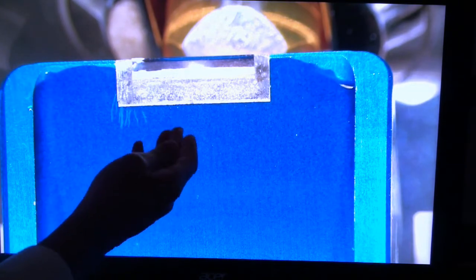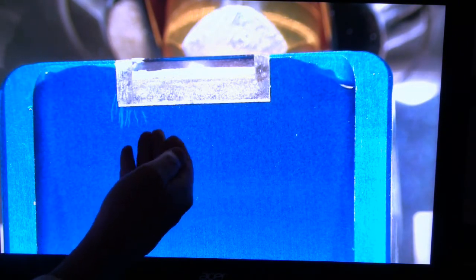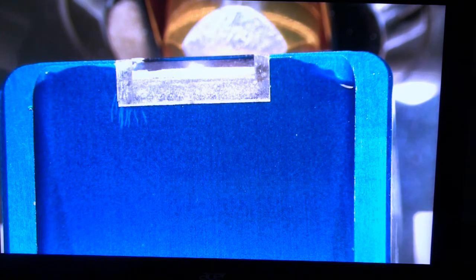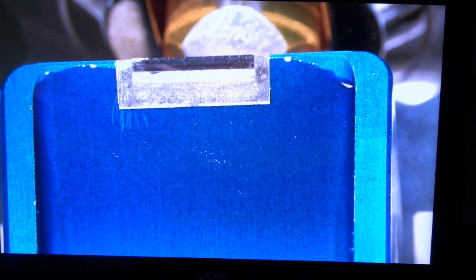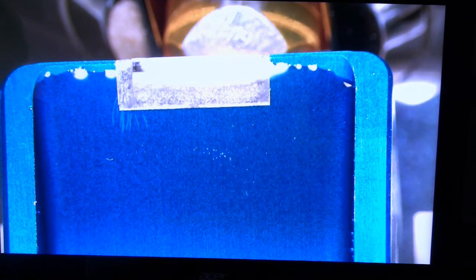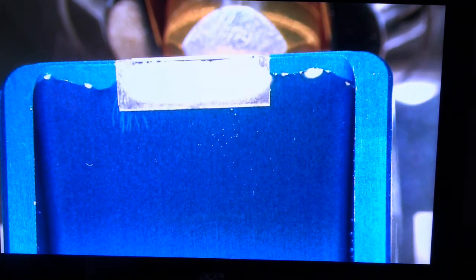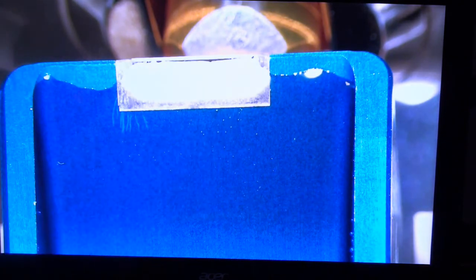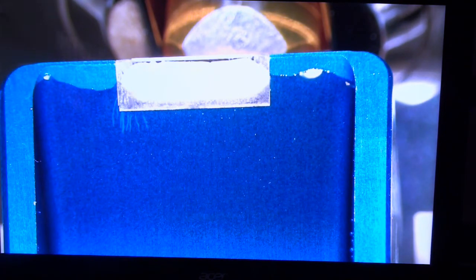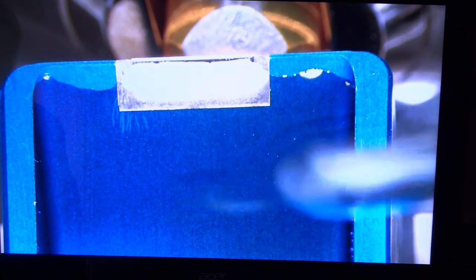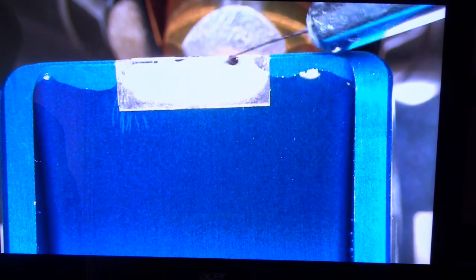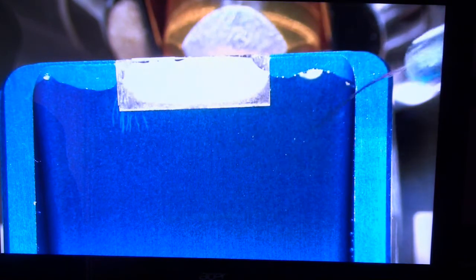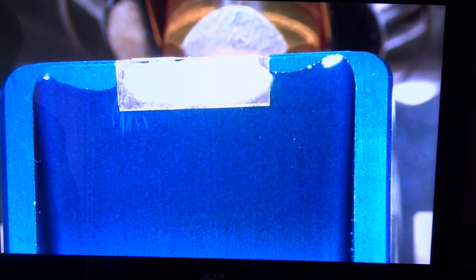And of course I'm doing all of this under the dissecting microscope the binoculars that are on the ultramicrotome itself. It's a good idea to get the water good on the sides too. Otherwise when the sections come off they can float over to the side. The next thing to do notice is that the water is currently transparent. I can see right from the top to the bottom. And that means there's too much water in there. So I'm going to retract some water and that will provide me with a nice silver sheen. And that's an indication that you have the water at the correct level. Now notice I can't see the knife and the resin that holds it in there. Again, some of the water has drawn back from the knife edge. So I'm going to use my eyelash manipulator, again very carefully so that you don't hit the edge of the knife. And I just draw that across the front of it. I don't actually touch the edge of the knife, just the very face of it.